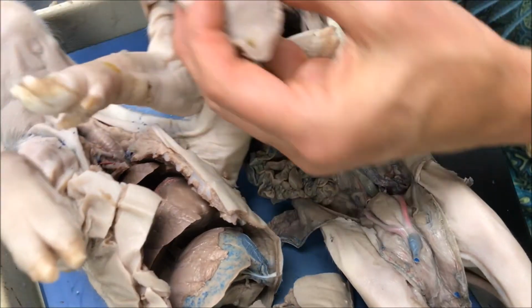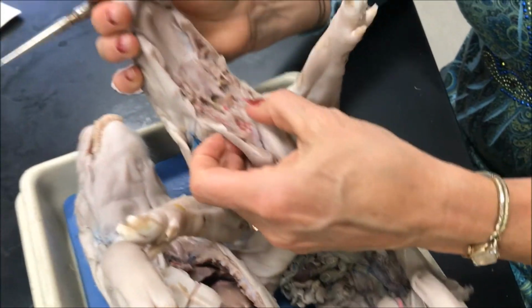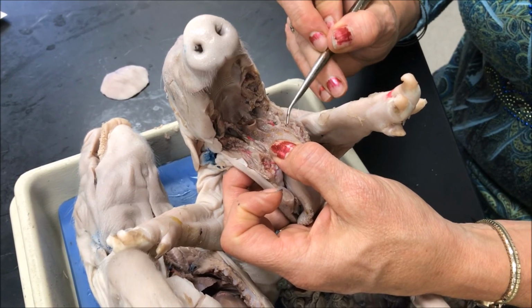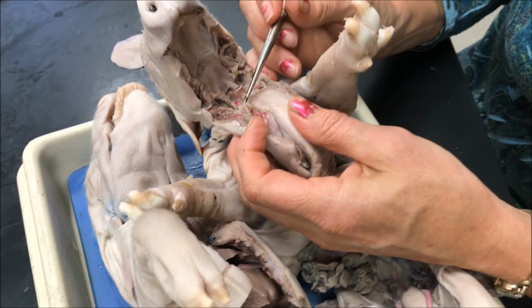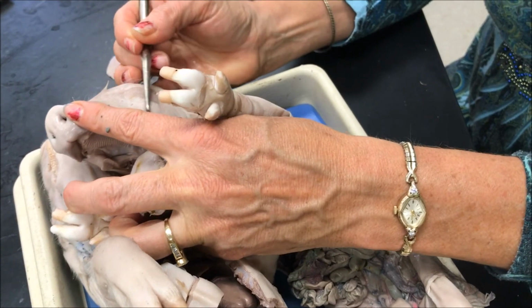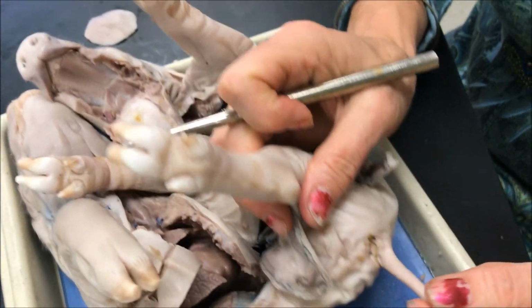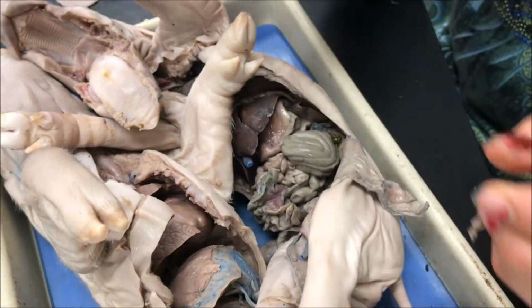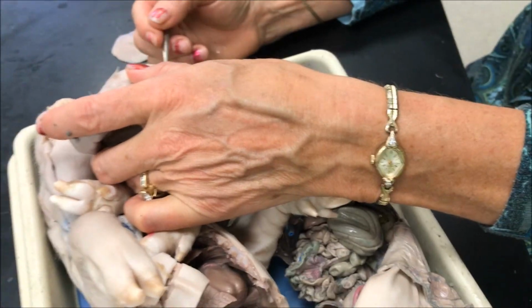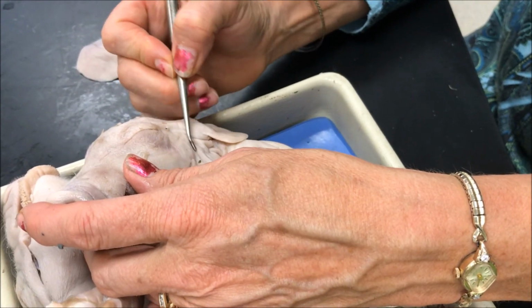The lower jaw is called the mandible to crush the food. The little bone that you cut when you opened up here is the hyoid bone right here, and that's the floating bone that the muscle of the tongue attaches to. The zygomatic arch is the cheekbone on the top of the jaw, and the caudal vertebrae are the vertebrae in the tail. A temporal muscle is up here on the side of the head. It's fan-shaped for chewing. The masseter is this big muscle on the cheek for chewing as well.